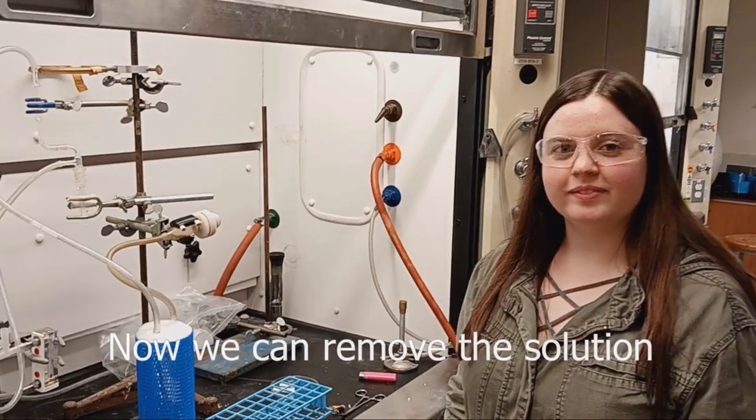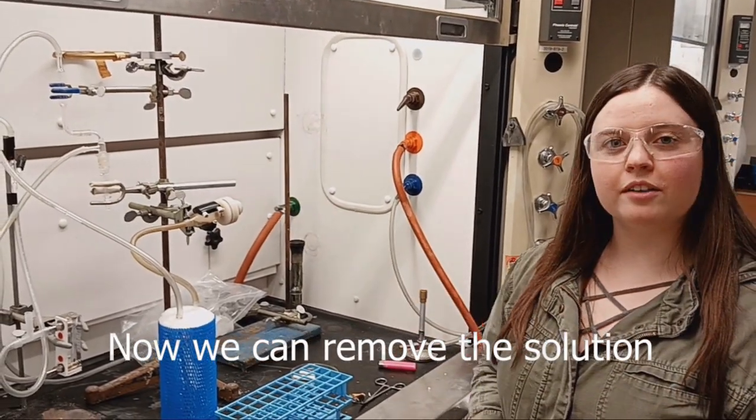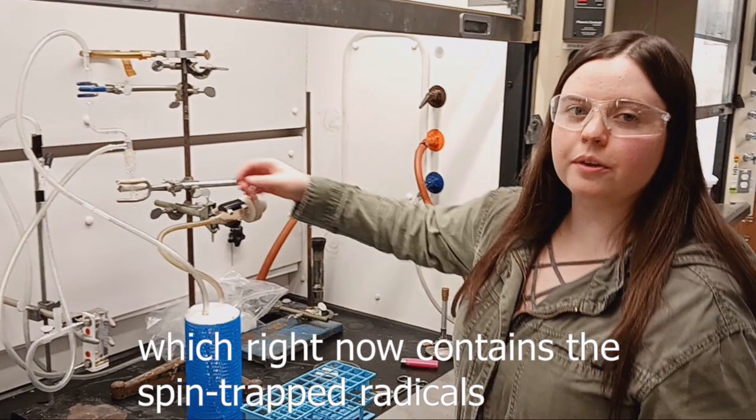Now we can remove the solution, which right now contains the spin-trapped radicals, and load it into the ESR tube.